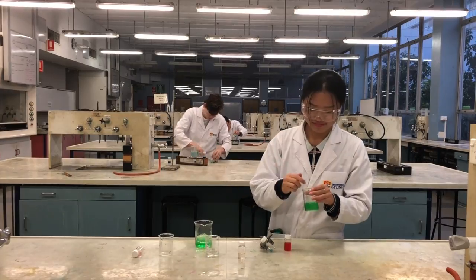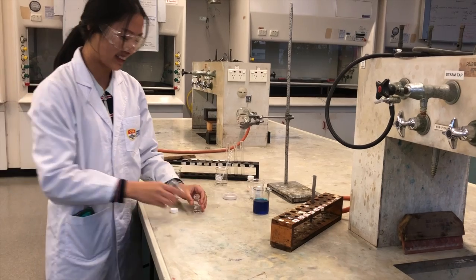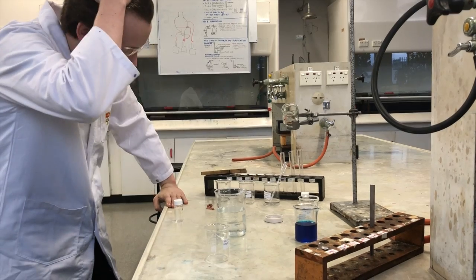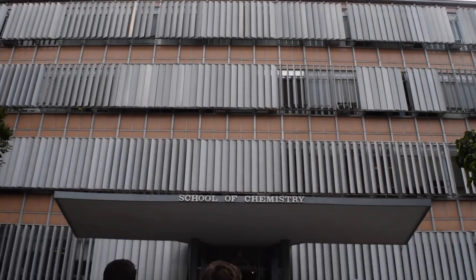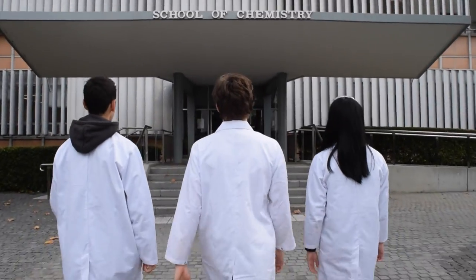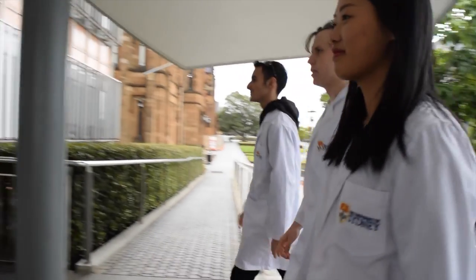Previously on MasterChemist Australia, our amateur chemists have been challenged with inorganic synthesis, but Ada, Marcus and Tom faltered under the pressure. Tonight, one contestant is about to go home. In MasterChemist, there is no time to play it safe. To keep themselves in the competition, they must follow the method closely, and most importantly, understand the chemistry.